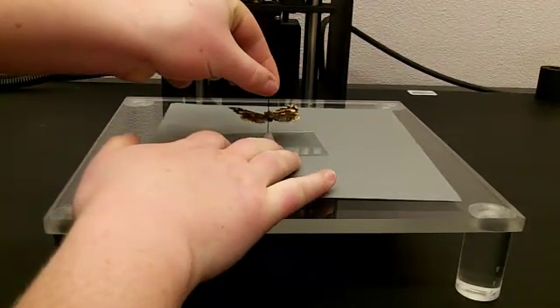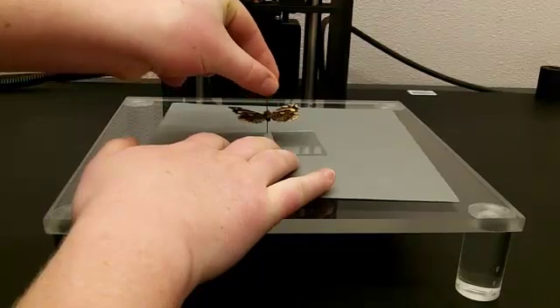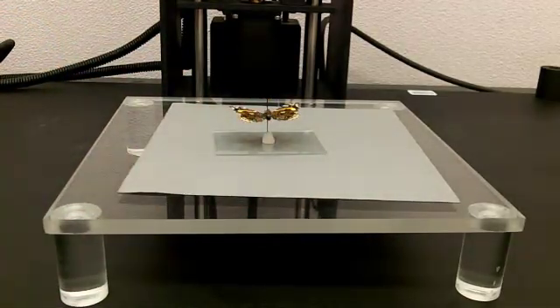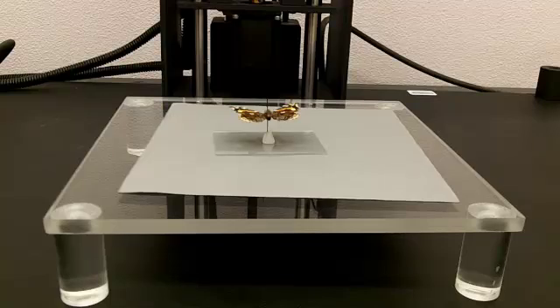We make sure our specimen is level and we are all ready and set up to go to take our ventral shot.